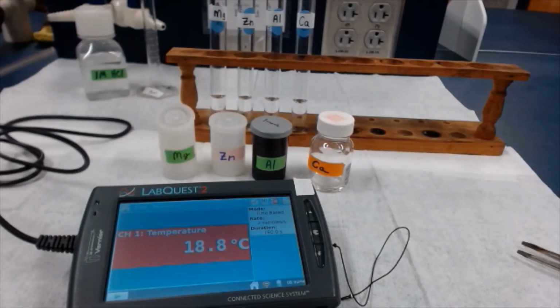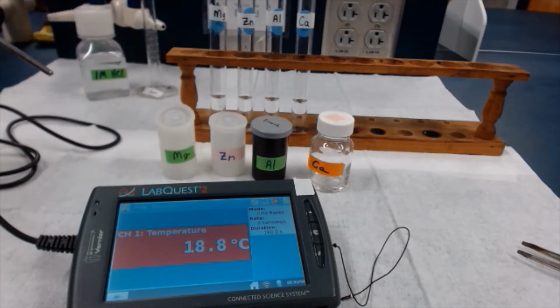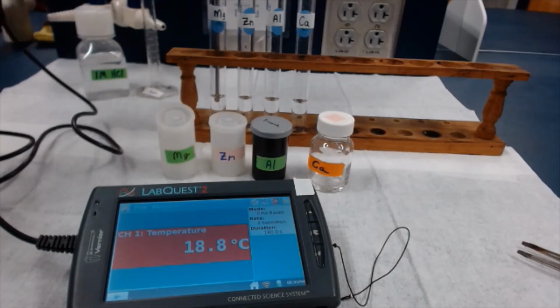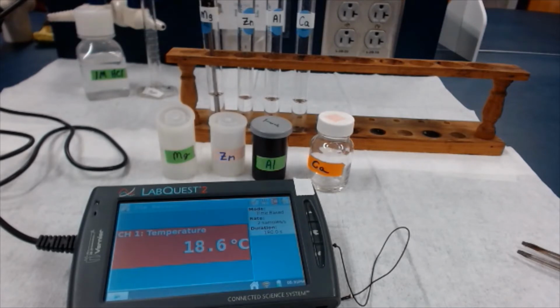Next, I'm going to take the initial temperature of one of the liquids, because if we're going to measure the temperature after the reaction, we might want to know how much the temperature went up. You can see right now room temperature is a little on the chilly side, about 18.8 C. I'm going to just put the temperature probe into the first test tube. Now, I won't have to do the initial temperature of all 4 test tubes, because you would think that this liquid being out at room temperature the whole time, all those test tubes are going to start out at the same temperature. Okay, so initial temperature looks like it has stabilized. Oh, just went down a little bit. About 18.5 degrees C. So we'll jot that down on the data table where it says initial temperature of acid.